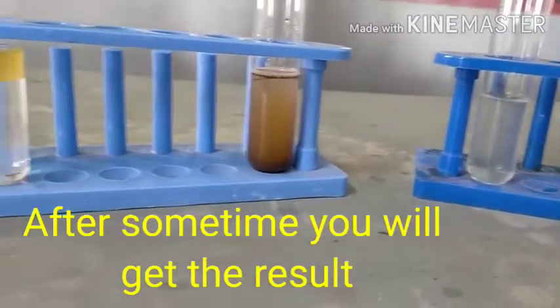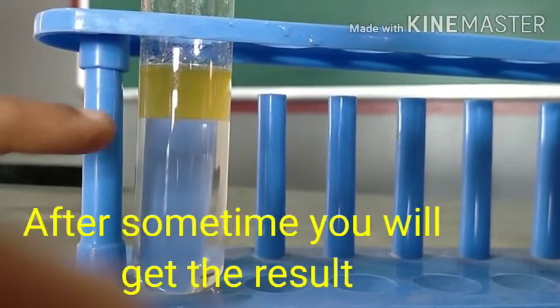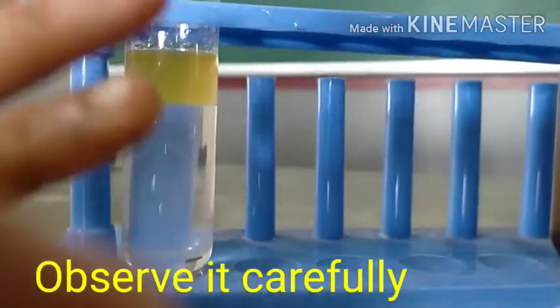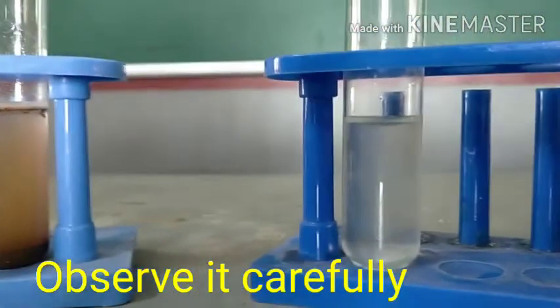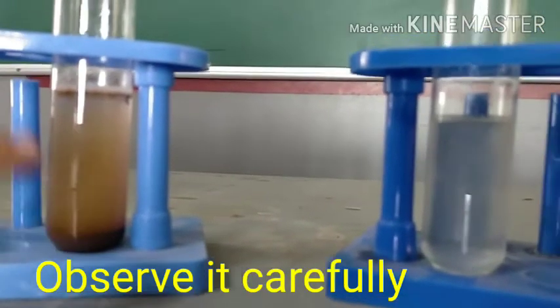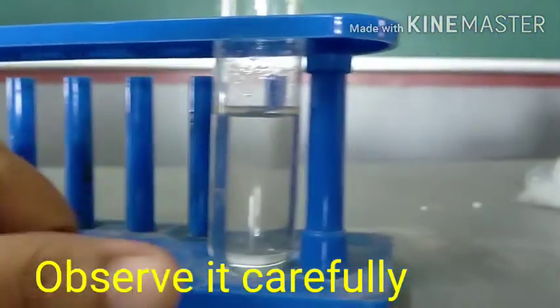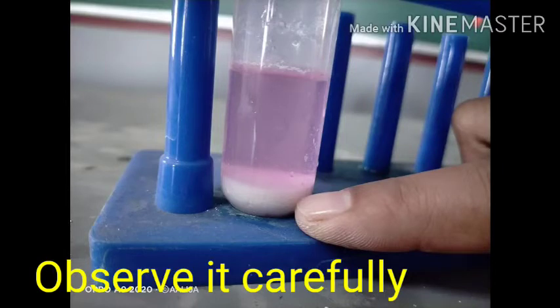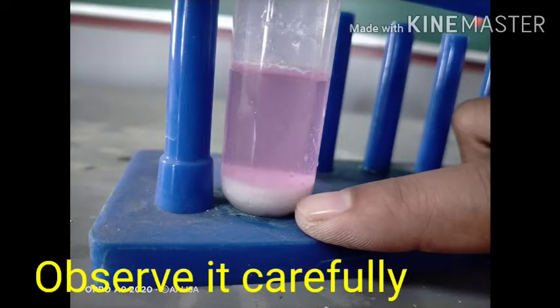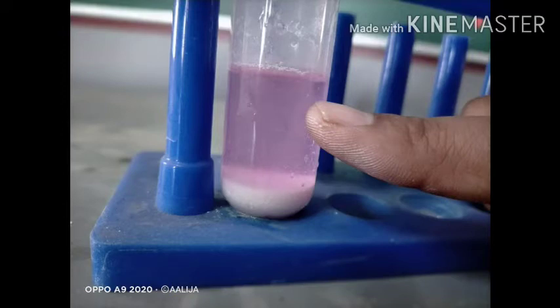If you observe carefully, after some time you will get this result. Somewhere you will find two layers, and somewhere you will find everything dissolved in the water. See here — two layers, and here also two layers. It means oil and soil do not mix well into the water, that is why you can see two layers. Chalk powder is also not dissolved in the water, so you can see two layers there as well.